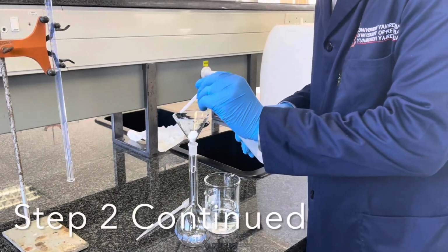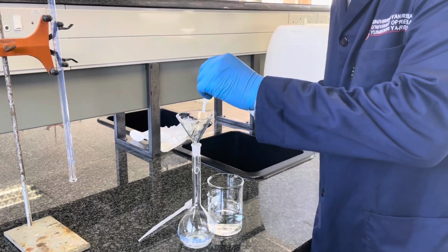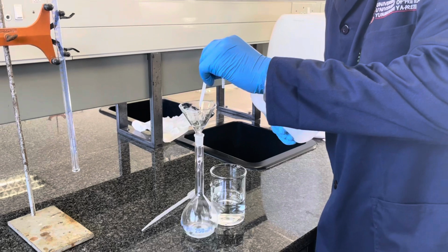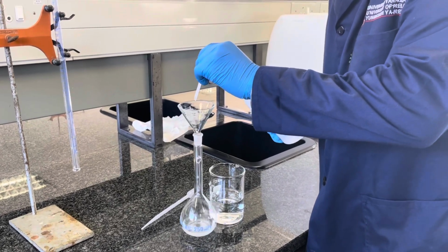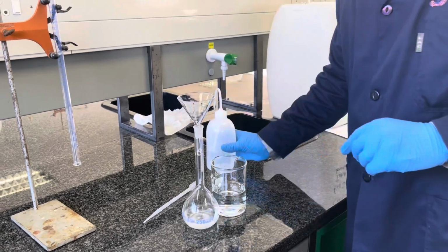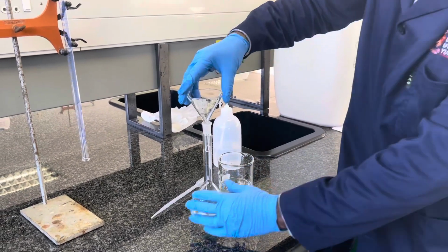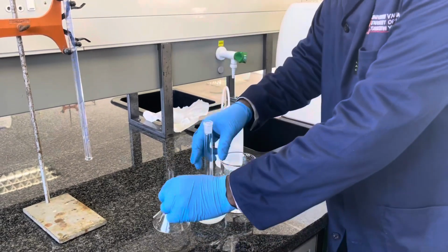In the next step, you will transfer your potassium iodide or your appropriate salt from the funnel to the volumetric flask using distilled water. Rinse the funnel using a distilled water bottle as indicated in the video. Thoroughly rinse the funnel to ensure that you transfer all the salt into the volumetric flask.